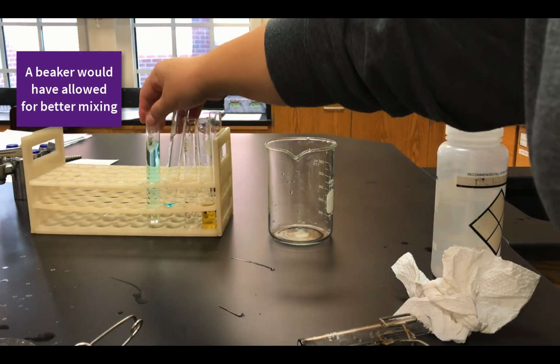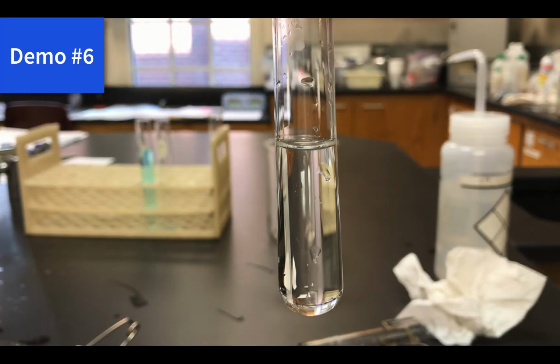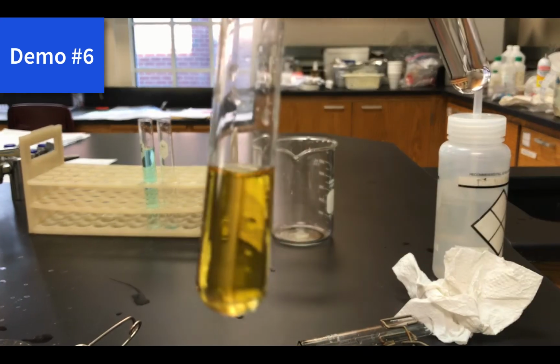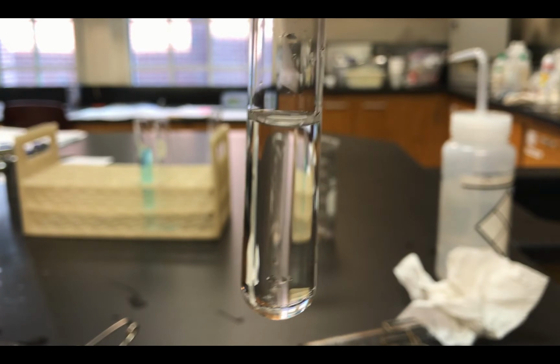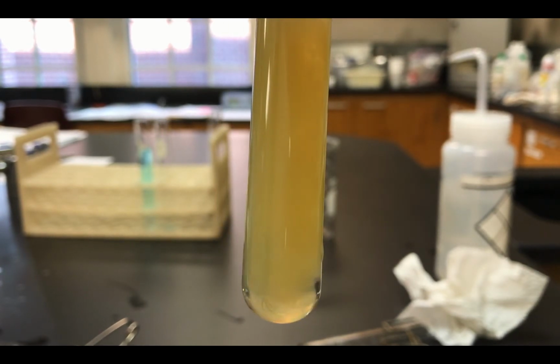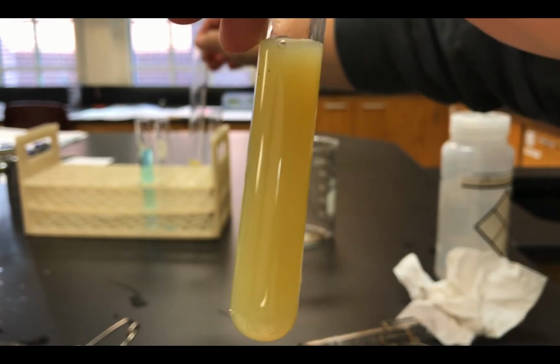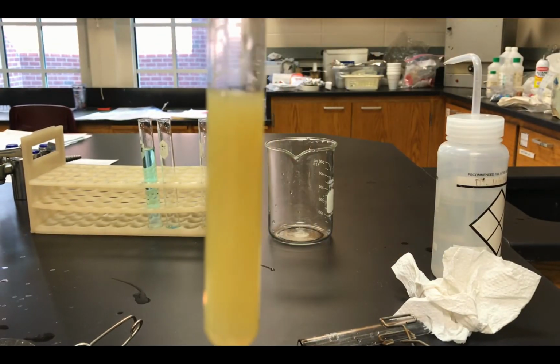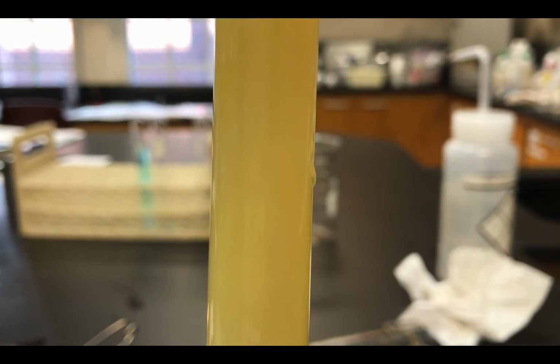Now we're going to do demo number 6. Here we have some aqueous sodium phosphate and aqueous iron 3 nitrate, and then we're going to mix them together. Behold, your observation. Take good notes so you can piece it all together with your reaction later.